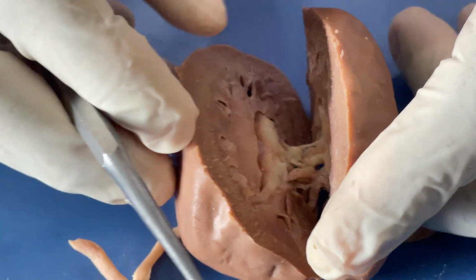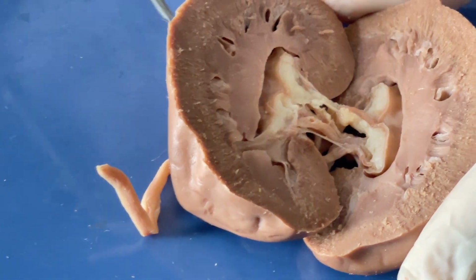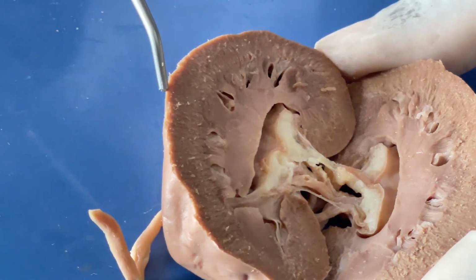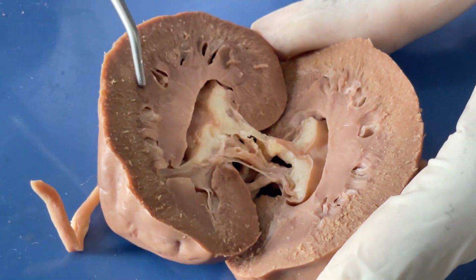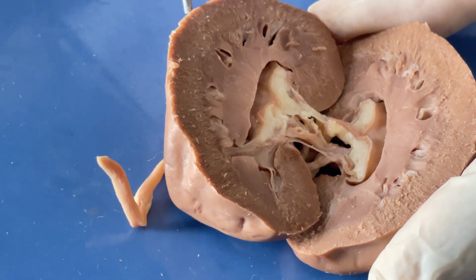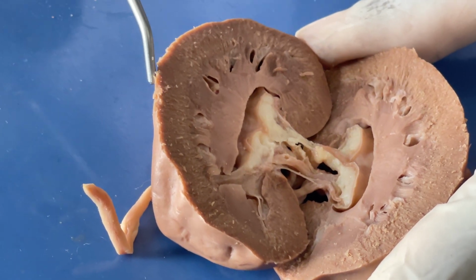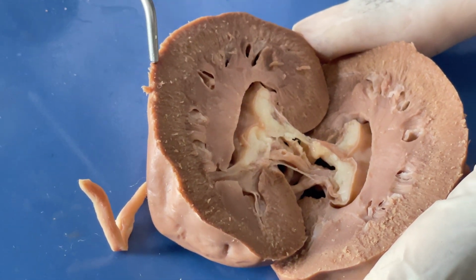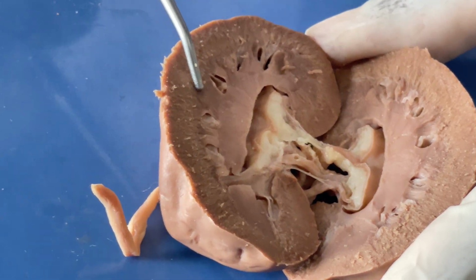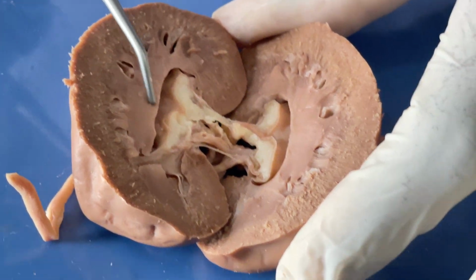We have already done the bisection to save us time. Now, with the internal structure, we have the renal cortex, which extends from here to this place. But before that, we have also indicated that this external surface here is the renal capsule. You can just feel the smooth surface here. Then from there, we have the renal cortex between this place and that place. Beneath that, we have the renal medulla. From here to here is the renal medulla.